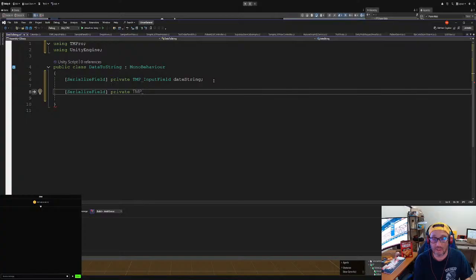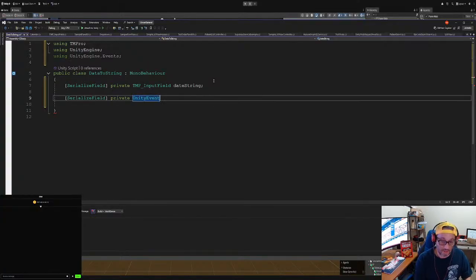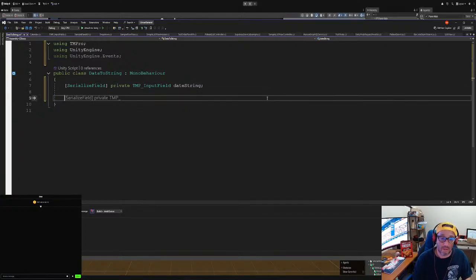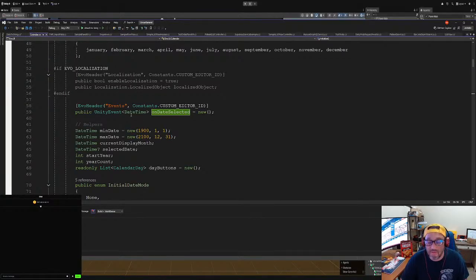Okay, so then we don't have to, but I like using Unity event. Unity event, and then, oh wait a minute, no, we can't do that. Unity event. That's it. No. So what we want to do is, oh yeah, we don't want to do that. So we want to use what was this guy using, calendar? He's using a Unity event date time. Okay, great. So then we should just use a method that, okay, grab it.